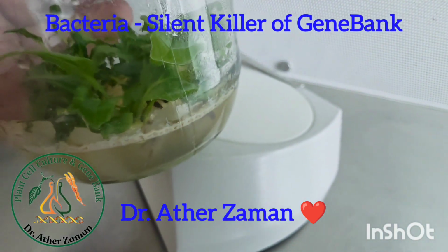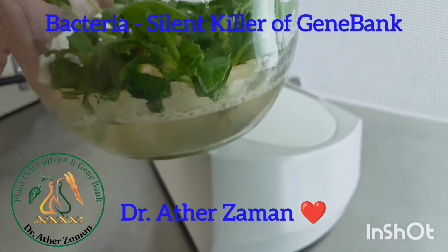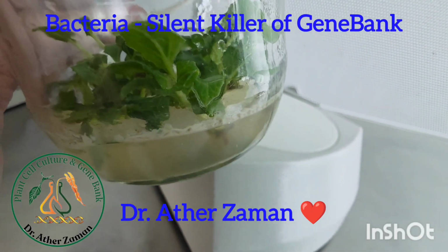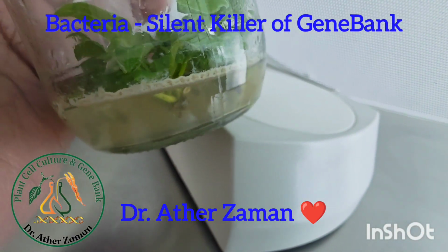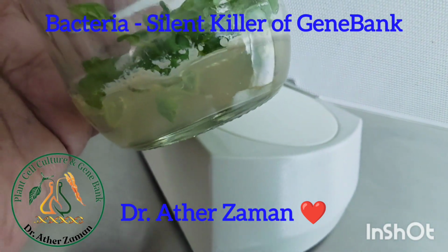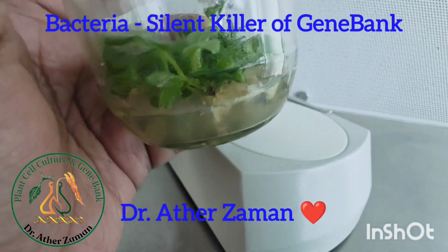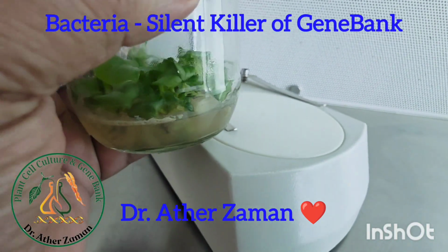See, this is not an early stage, but this is one of the signs of in vitro contamination. This is the bacterial contamination. The color, you see, is off-white to light yellowish. You cannot help this culture, except you can have a chance for in vitro rescue, but that will not give you 100% success, even if you treat the plants with antibiotics or whatever. So this is very vital.